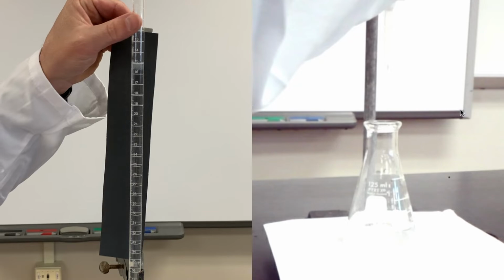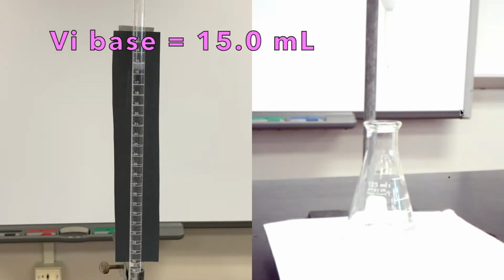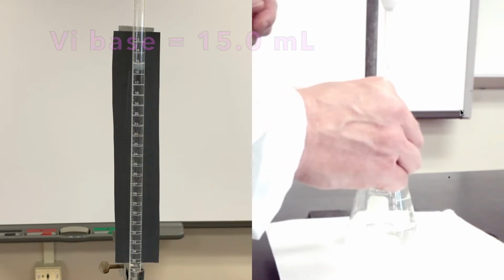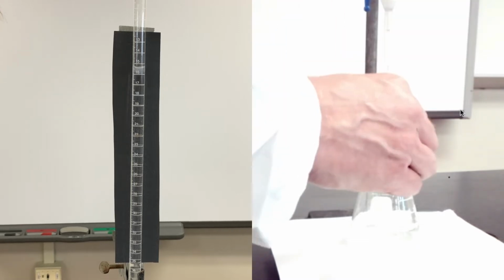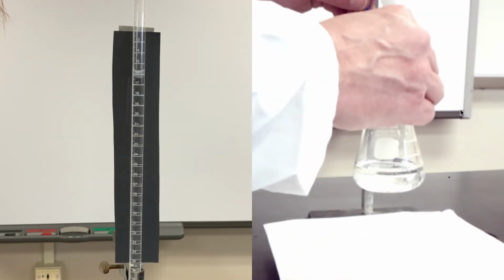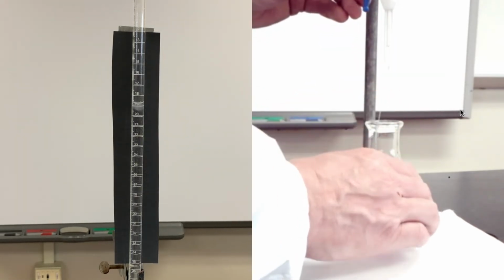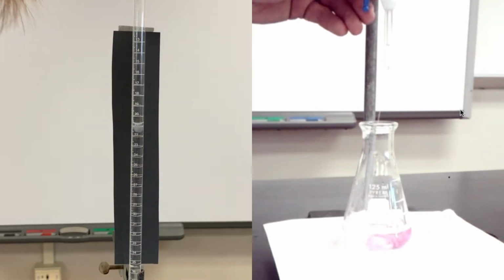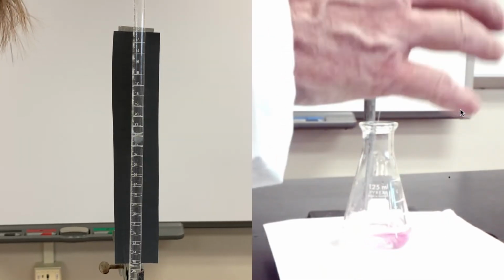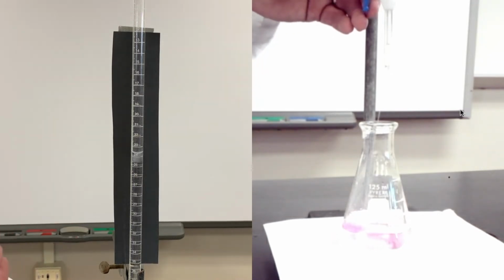Yeah, I've got my base at 15. That's the initial volume for my second trial. Second trial, we're at 15. We're gonna put 15 milliliters in. We're gonna see some color changing here. So let's go ahead and add that. Got my stopcock open. It's gonna flow a little bit slowly here. So because I know last time it took me about 15 milliliters to get to where I needed to be, I'm gonna shoot for about 30 and slow it down.